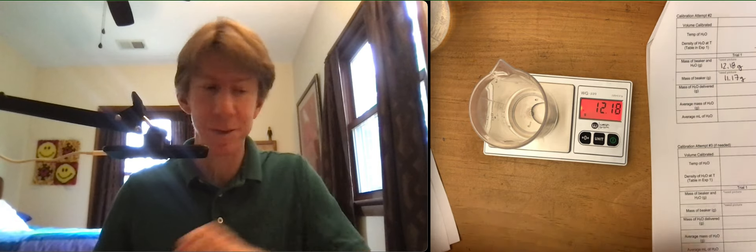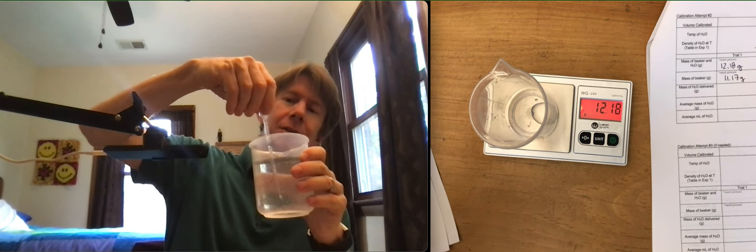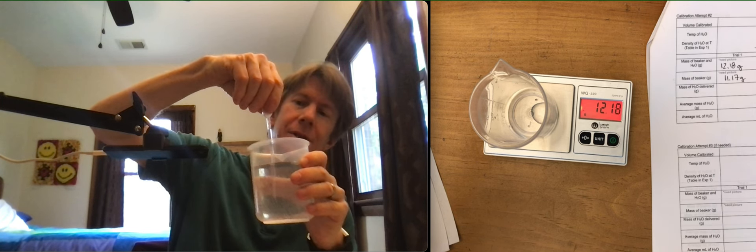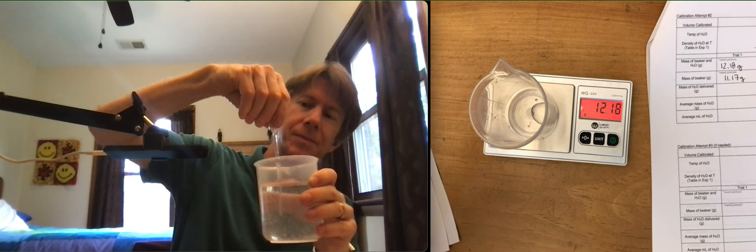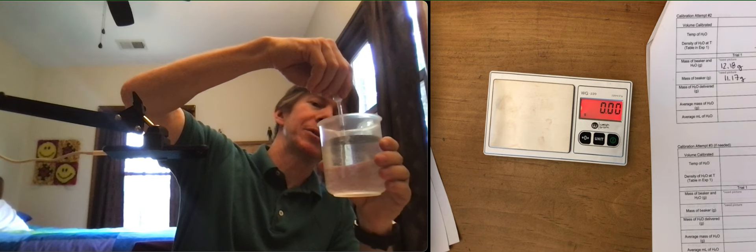Air bubble. All right. I'm taking it off this time. I do not want to spill water on my scale.